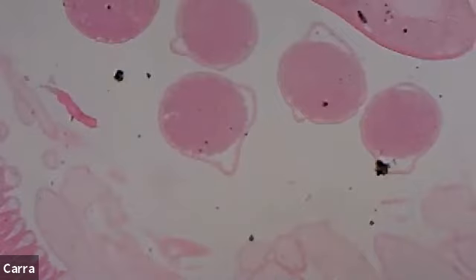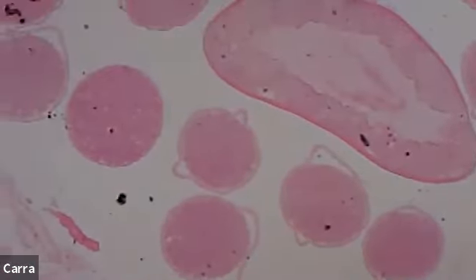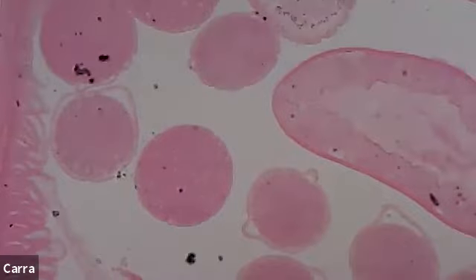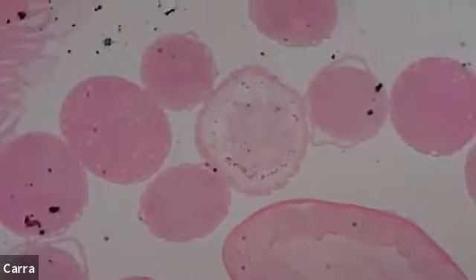So let's move up here. And actually you can see there's a ton of space in this. So when we think about space, what we're really talking about is that coelom, right? And there's lots of little tiny, I want you to look at these balls. See how they look like little ornaments to me. There's lots of similar sized balls, and these are all organs. But interestingly, we talked about how coelom formation increases complexity for organ formation.